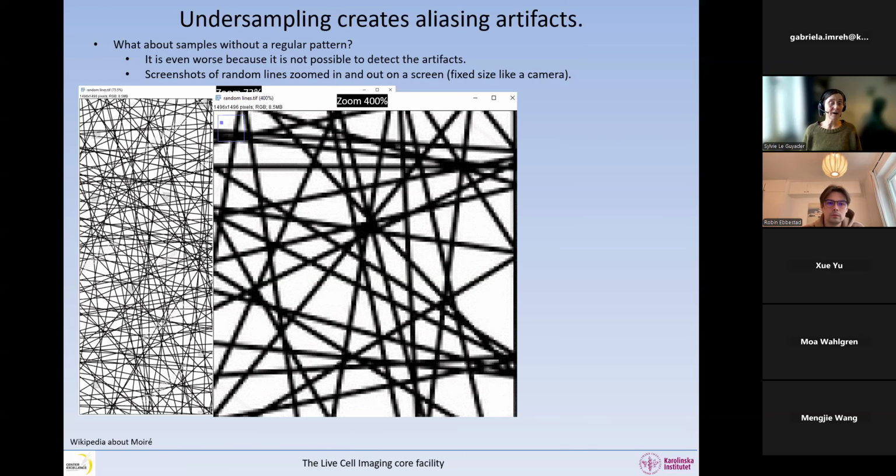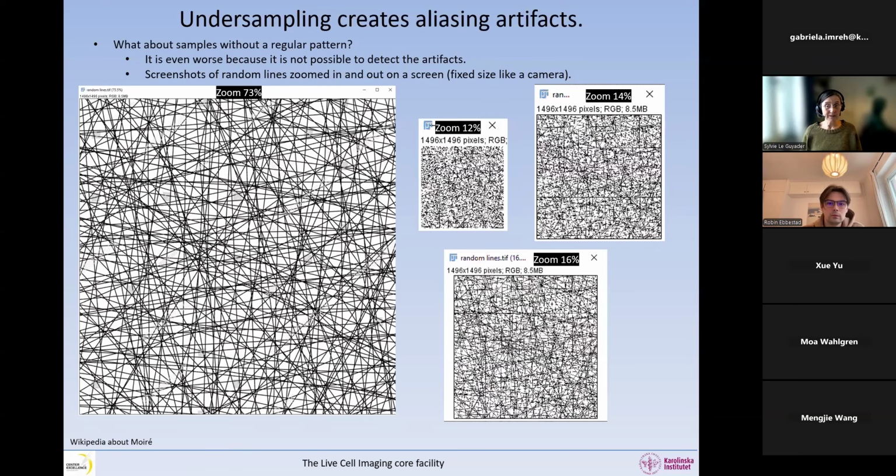But now if I zoom out, look what happens. Where are the lines? The more I zoom out, I basically still have the same digital resolution in the background in my camera or my screen, but I make the objects finer and finer. And you can see what happens. I'm losing the lines. Now I'm getting lots of little dots. But you see, this line is still there. Somewhere in here, there is a line like this. Yeah, this one is still there. And this one is still there.